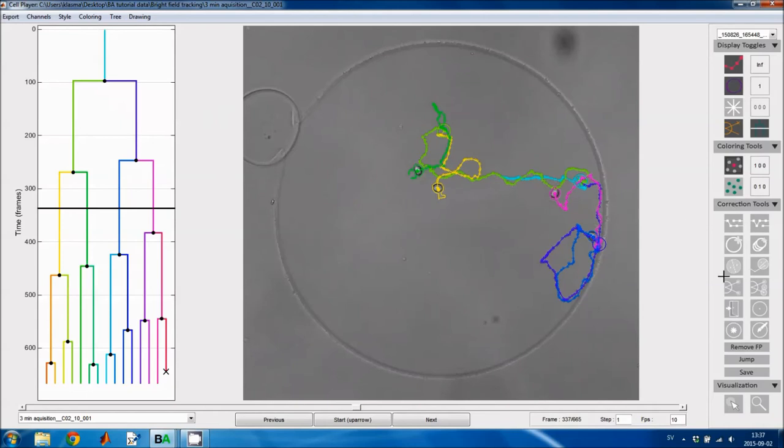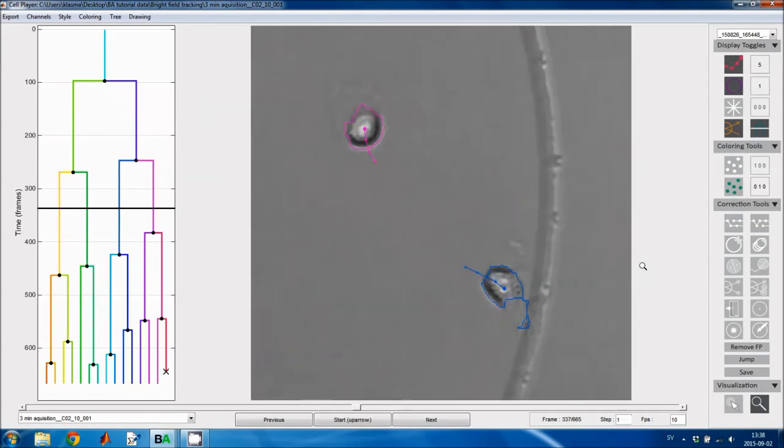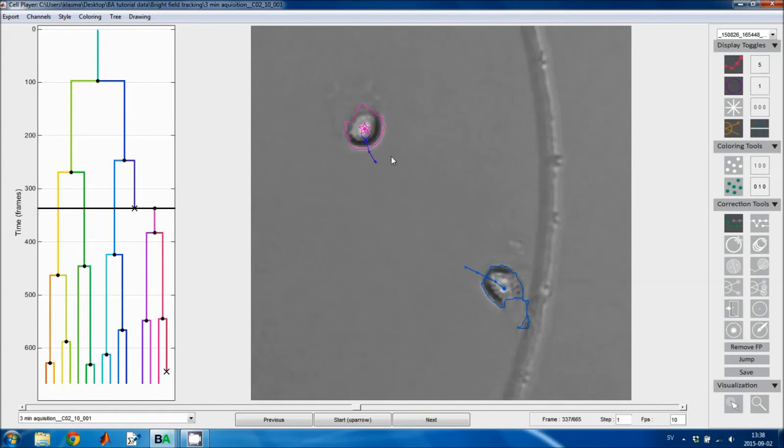Now we only have the track correction tools left. I will first explain the tools one by one and show how they affect tracks. And then I will correct all of the tracking mistakes that were made in this video. So this first tool allows you to change track links. So you click on the center point of a cell in the previous image. It's the filled circle here, or the small dot. And then I click on the center point of a cell in the current image that I want to link it to. And that's the large filled circle here.